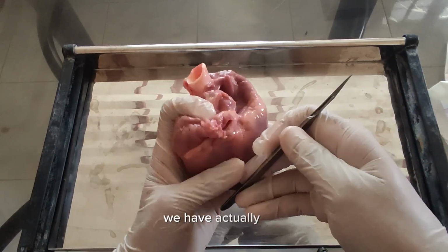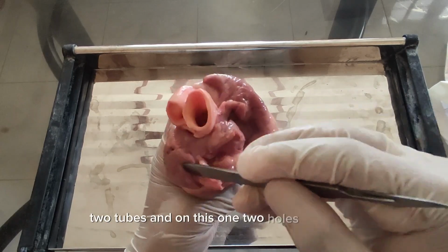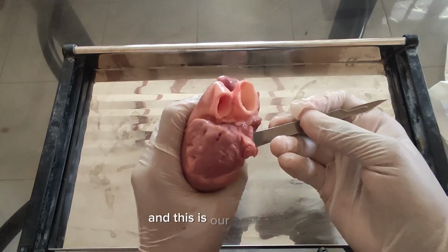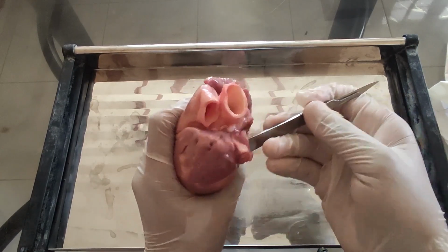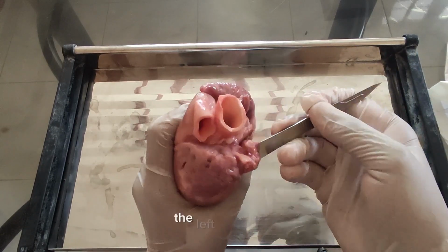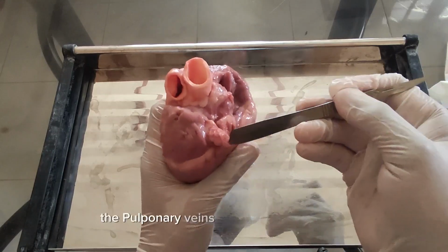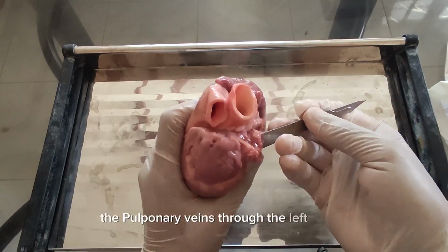We actually have two tubes in this one, two holes right here, and this is our right atrium. No, left atrium, by the way. The left atrium here. The pulmonary veins go into the left atrium.